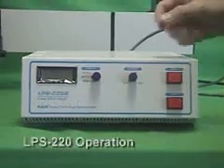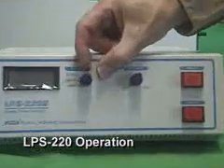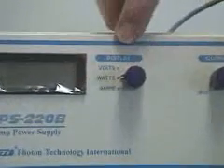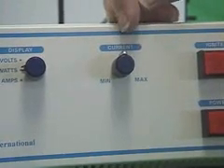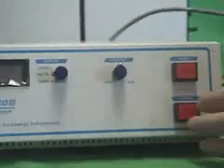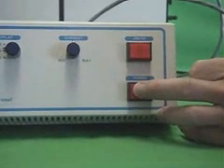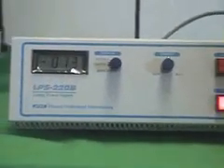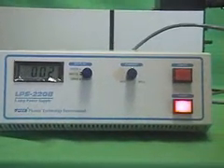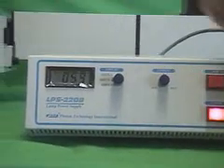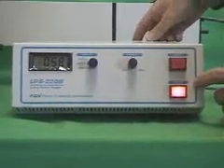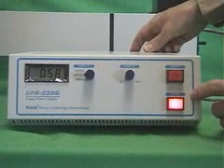When you first set up an arc lamp it is preferable to have the display knob on watts and the current knob at about 12 o'clock position on a clock face. Then you push the power switch in.